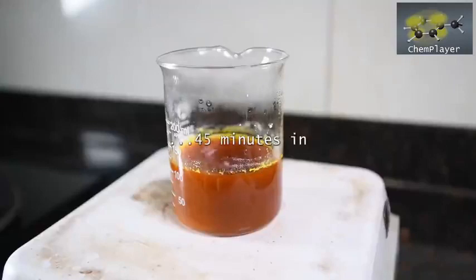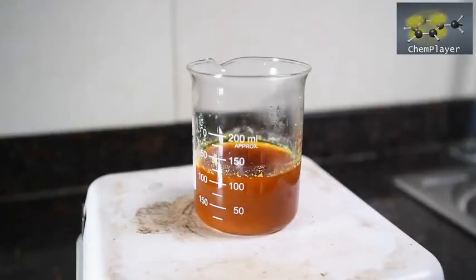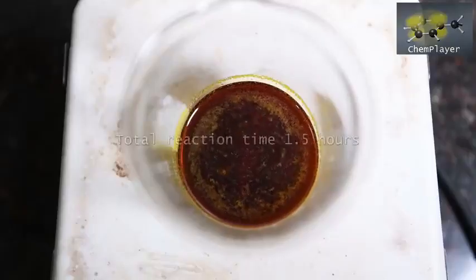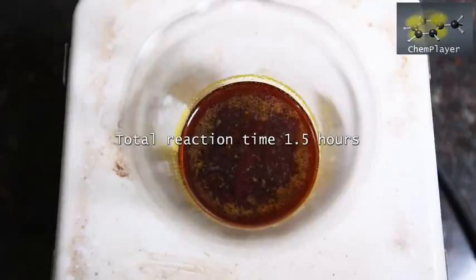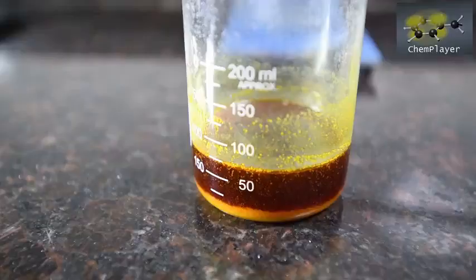Here's the mixture after about 45 minutes. We'll explain later what we think might be going on here, but sodium thiosulfate isn't orange colored. After an hour and a half of heating and stirring we stop the reaction. We have a fine sulfur precipitate in a red colored liquid, and the volume has reduced down with the heating to around 75 ml in total. We filter this while it's still hot.